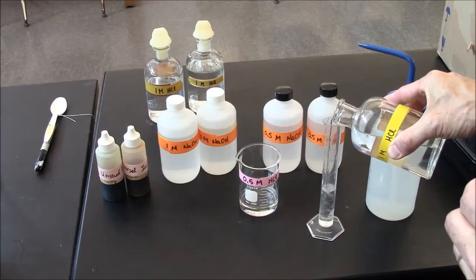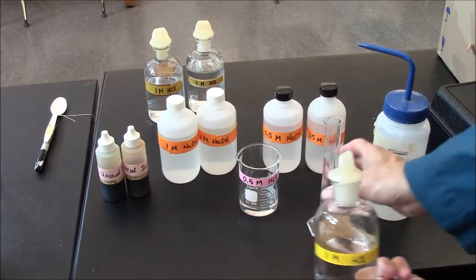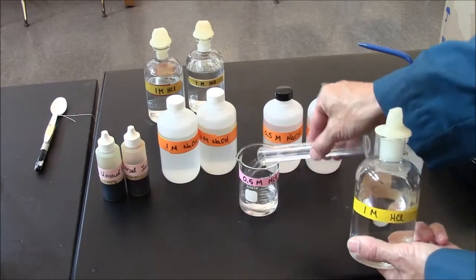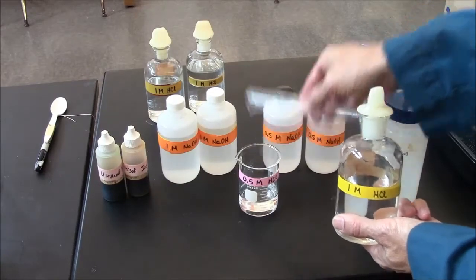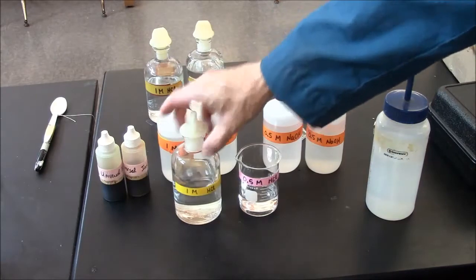I'm diluting the acid from one molar to half molar. So this will do it. I diluted by a factor of two. What was once one molar is now half molar.